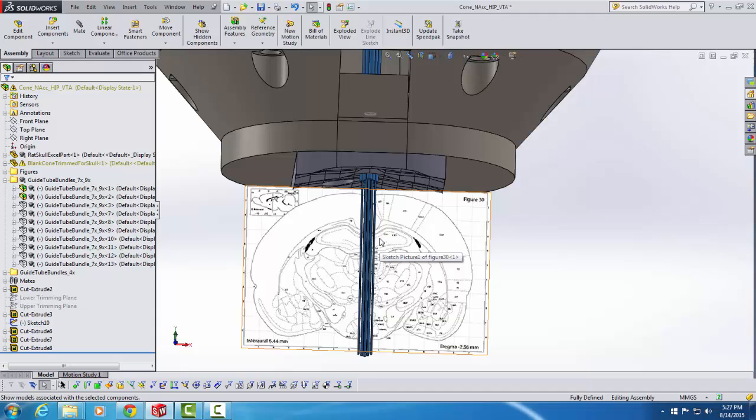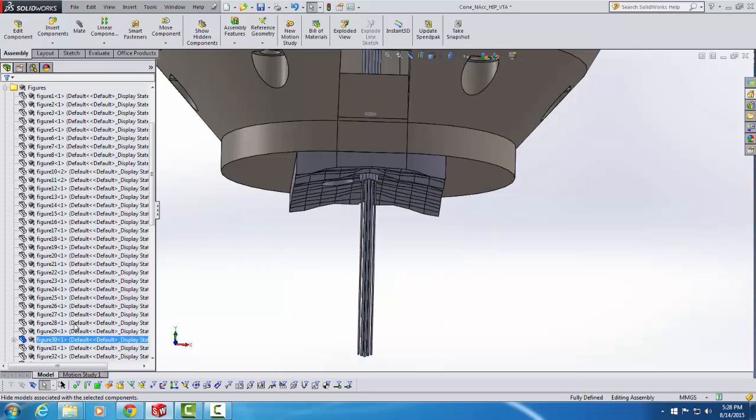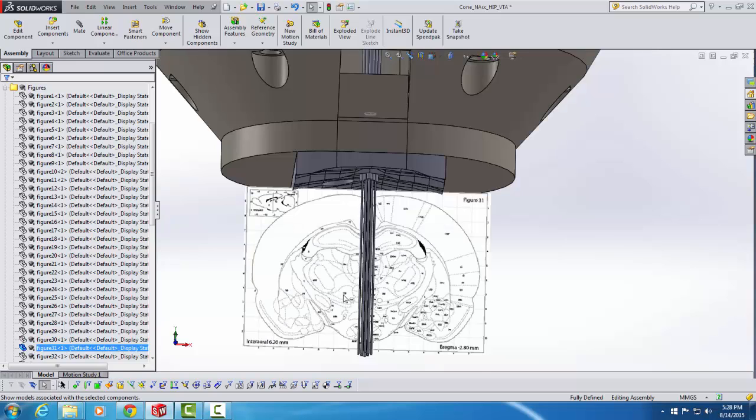I'm going to put this one on the left side of the brain. And I think that I'll put this one at a different coordinate. I think instead of minus 2.6 posterior to bregma, I'll make this minus 2.9 posterior to bregma. So I'm going to go back to my figures folder and expand it again. Figure 30 is the figure that I currently have visible here, but if I'm going to go a little farther back, I should probably hide this figure, hide components, and I'll make figure 31 visible instead of figure 30, because that one is a little farther back at 2.8 millimeters posterior to bregma, closer to my target of 2.9 in this case.